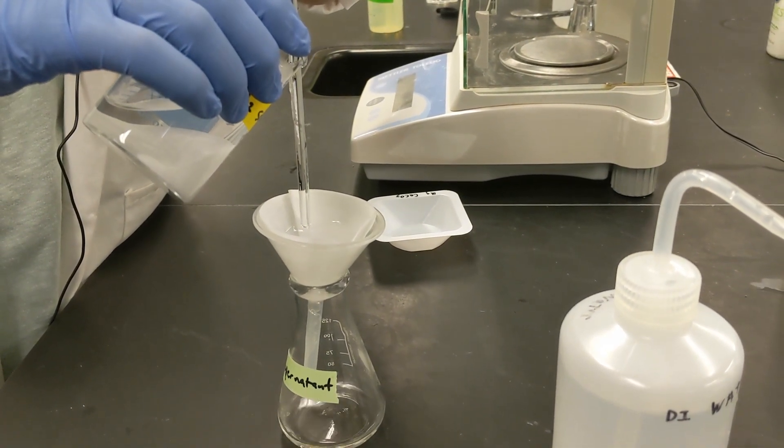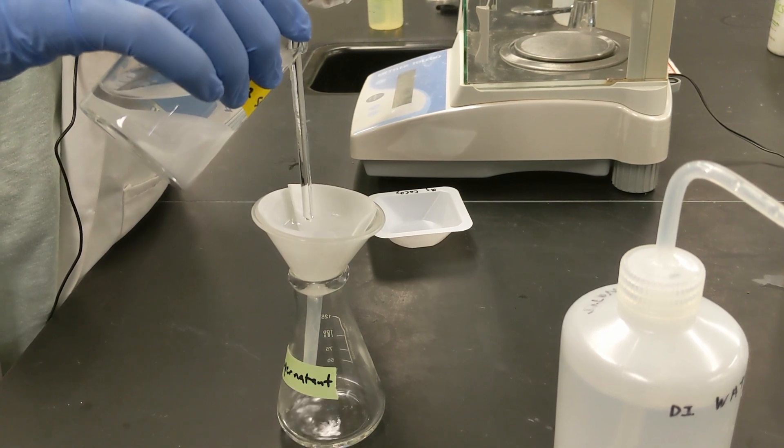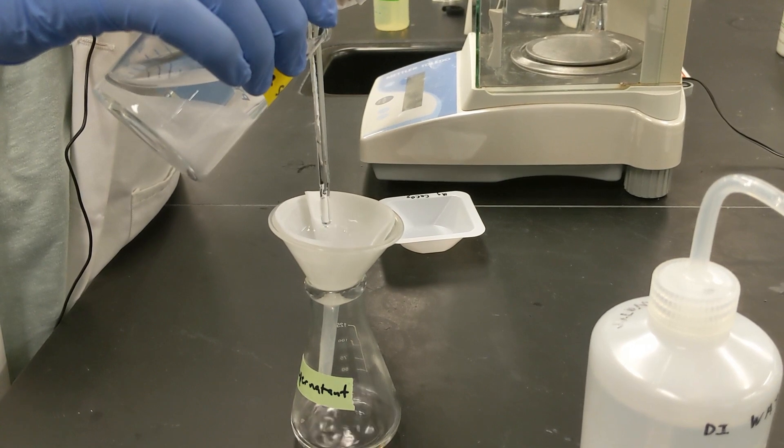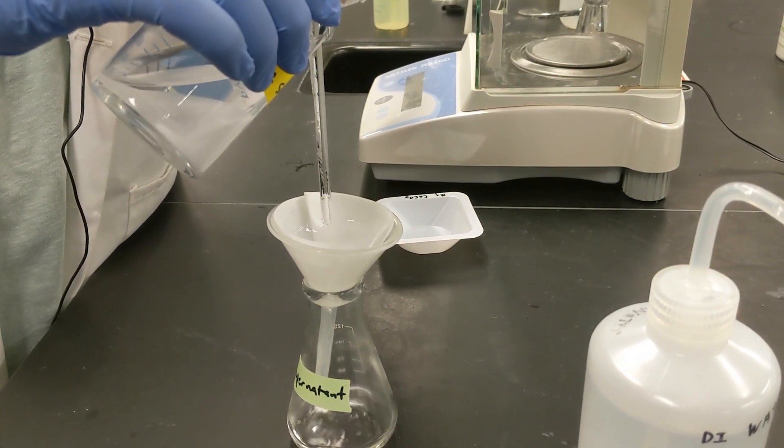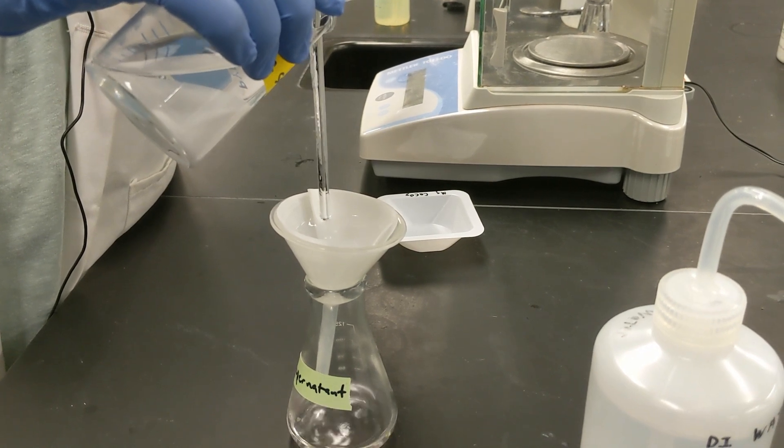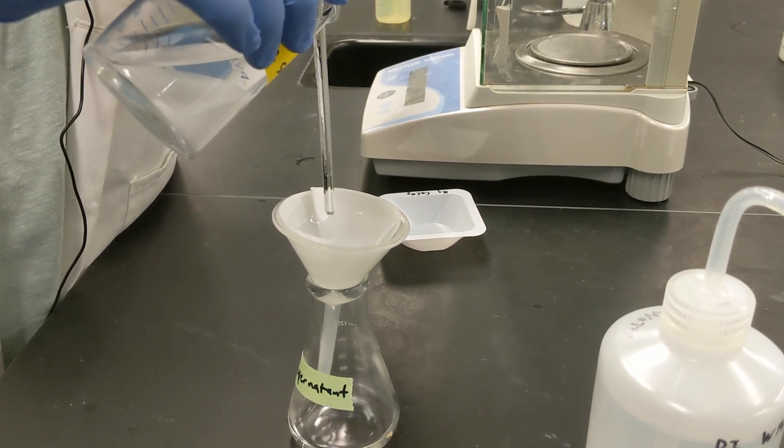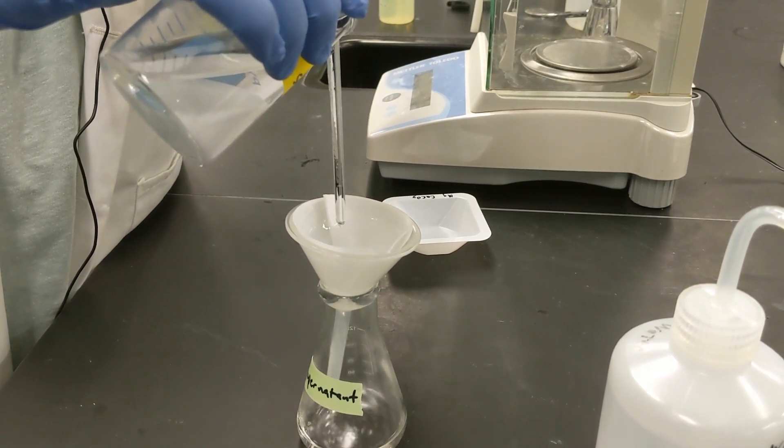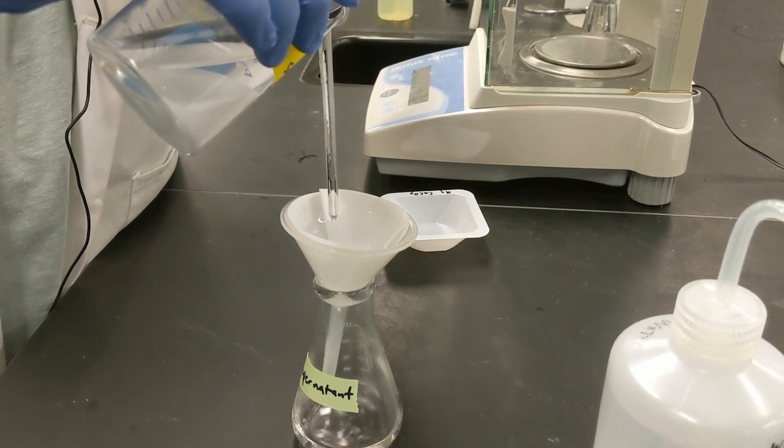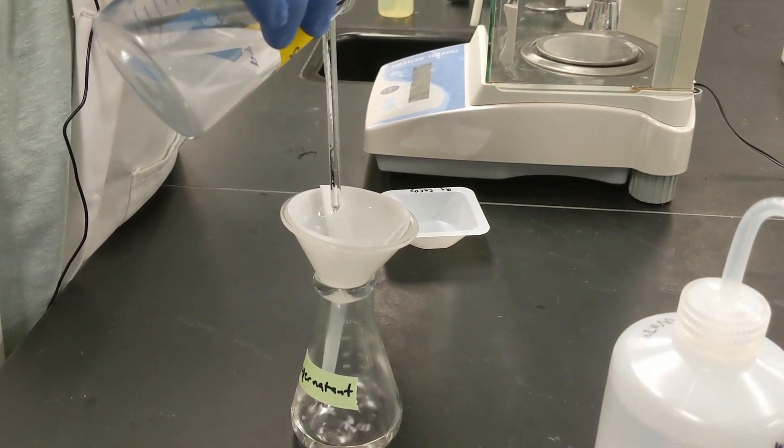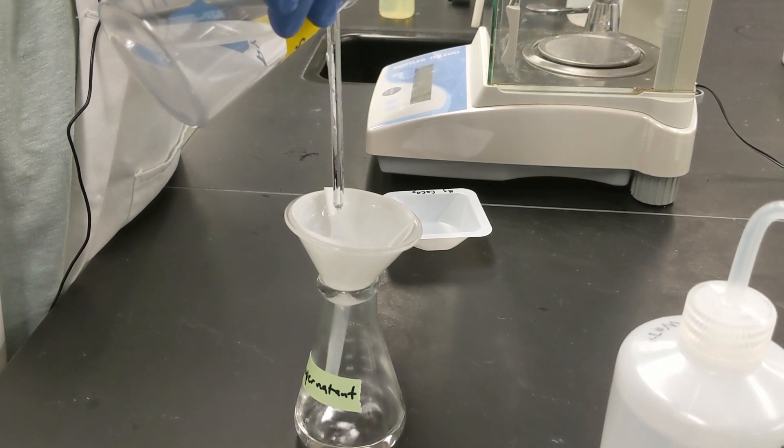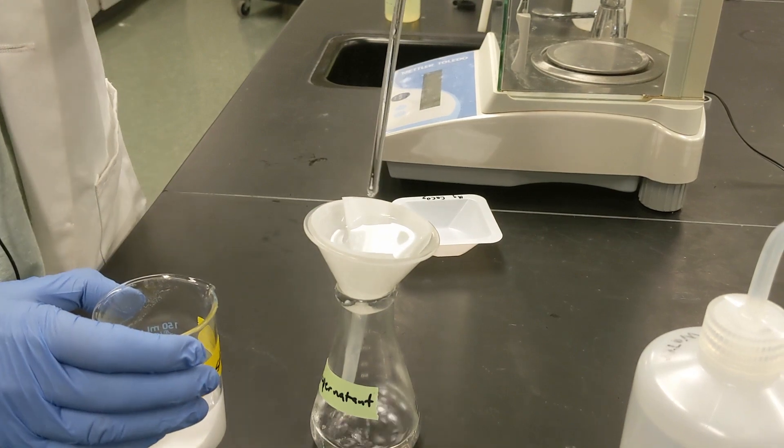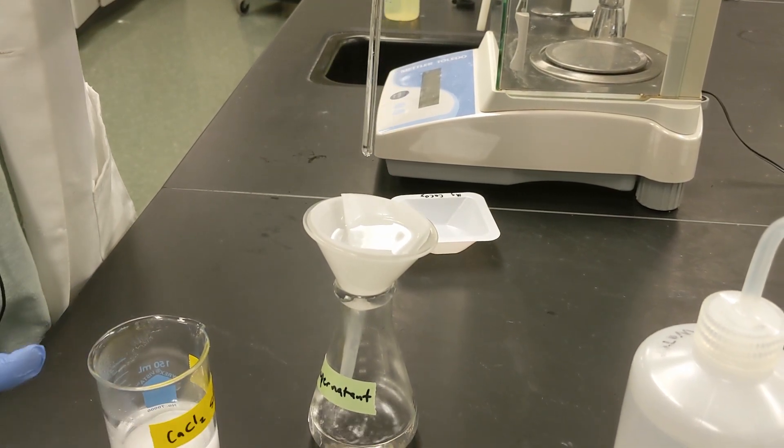So we're doing this carefully and allowing the filter to filter out any of the calcium carbonate that might be in the liquid. And you can see I'm doing this slowly so that I'm not overfilling the filter too much so that way it doesn't overflow. So it looks like it's kind of full so we'll let that sit for a little bit so it can finish filtering and we'll continue the rest of the liquid.